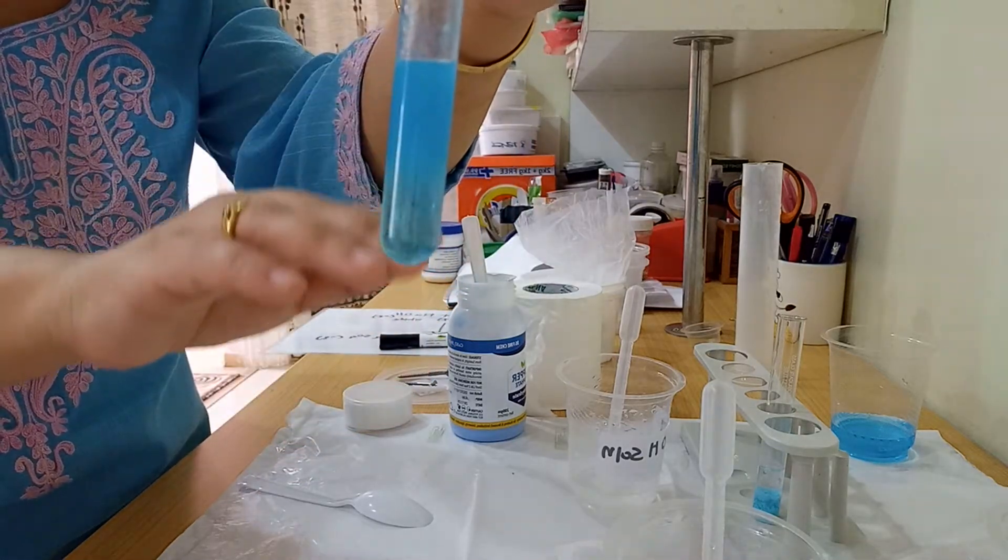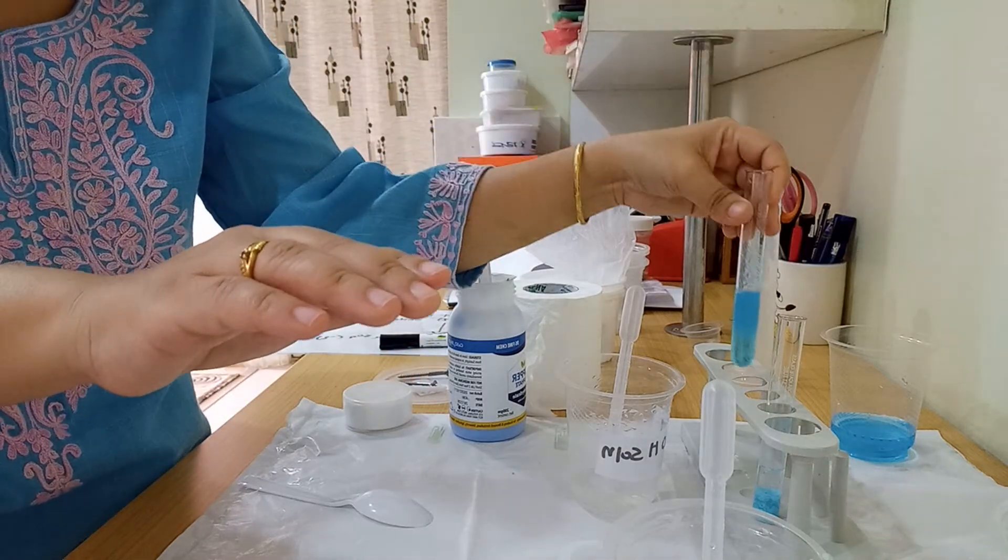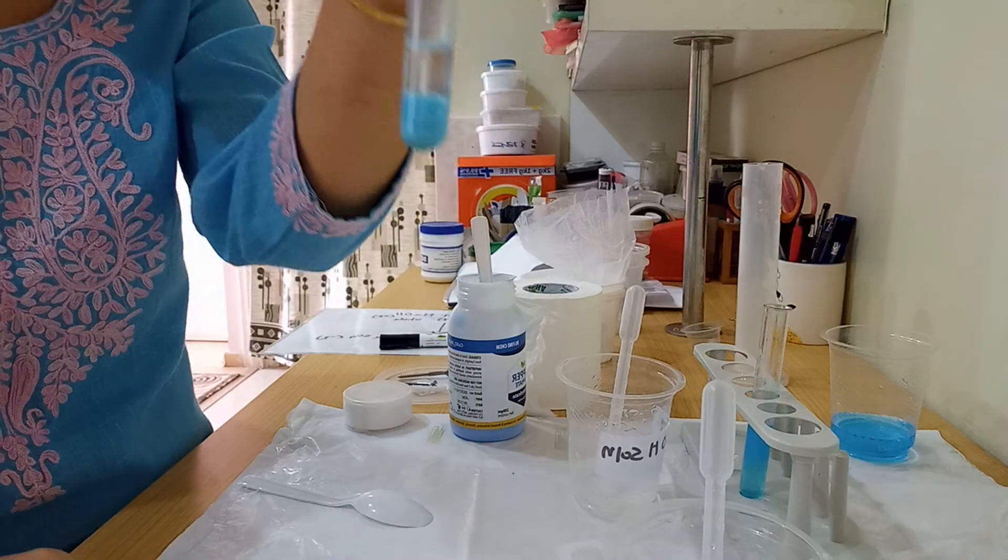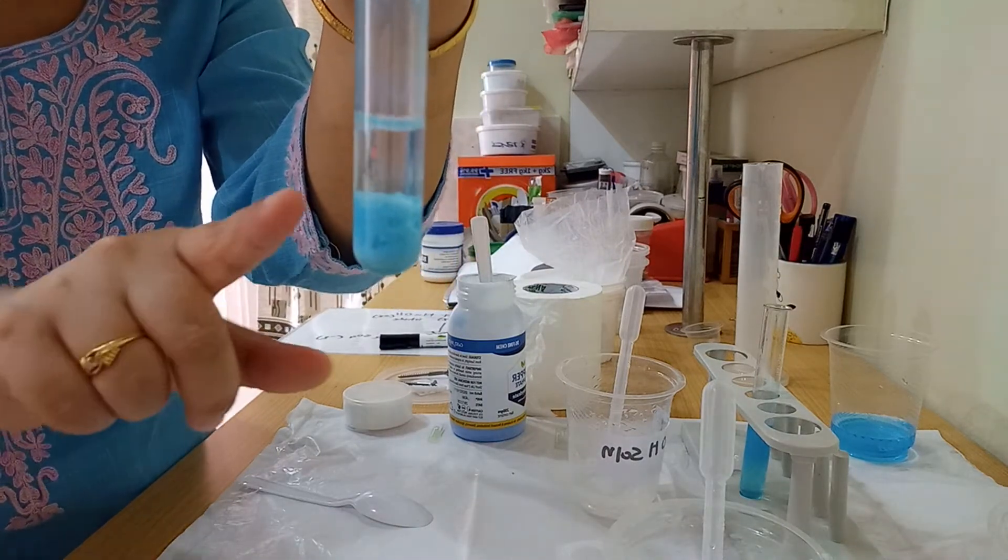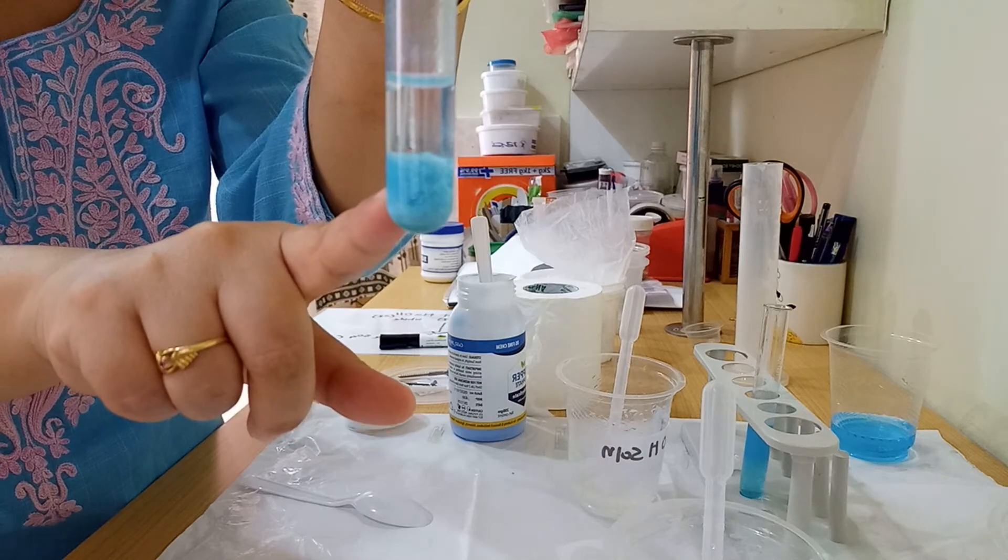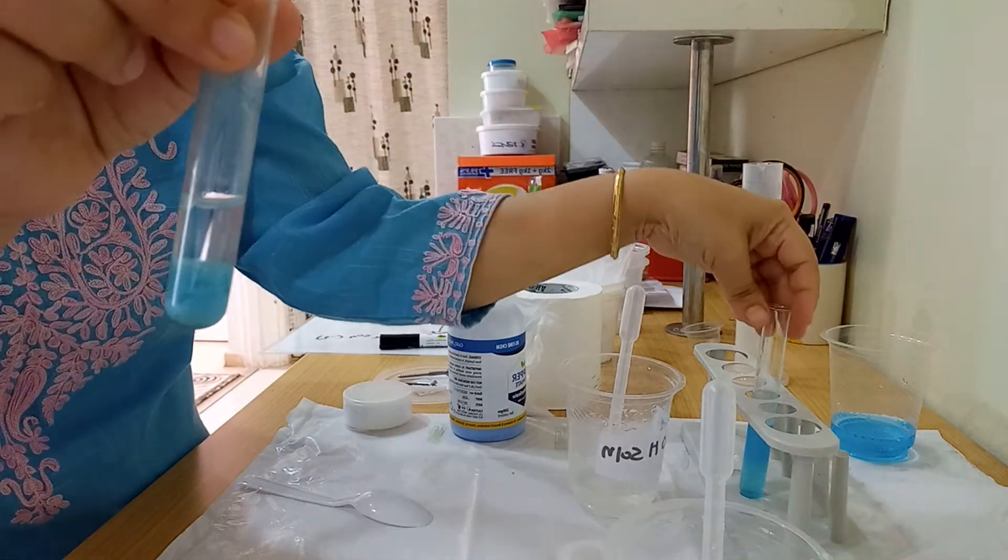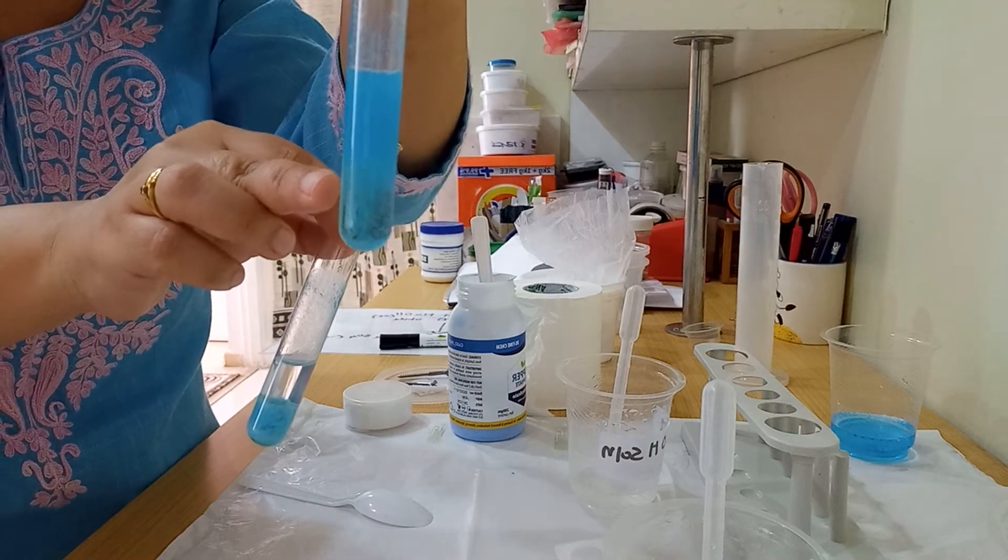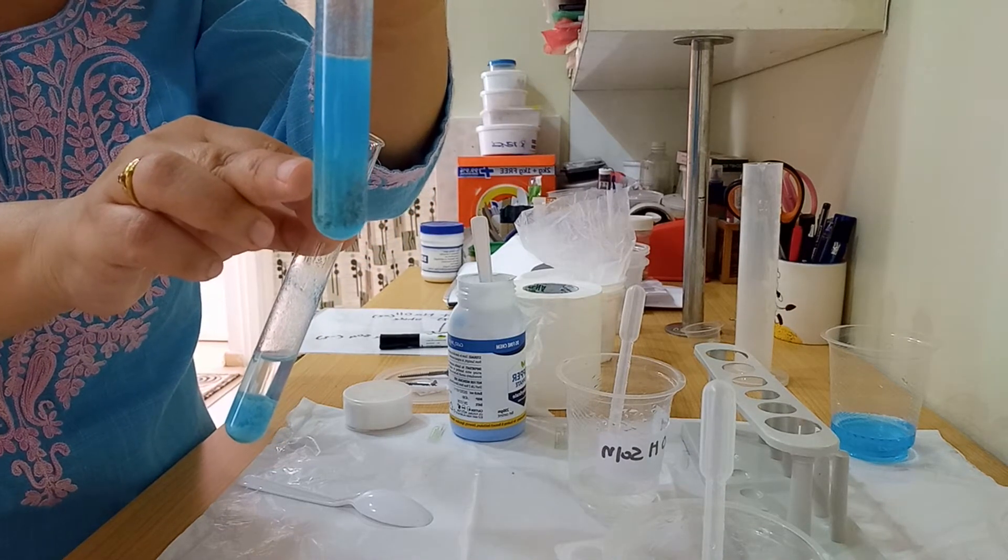Now slowly it will settle down. I've already done one experiment so I can show you how it looks. Can you see this one? All this precipitate has settled at the bottom of the test tube. The same thing is going to happen with the second test tube I just conducted.